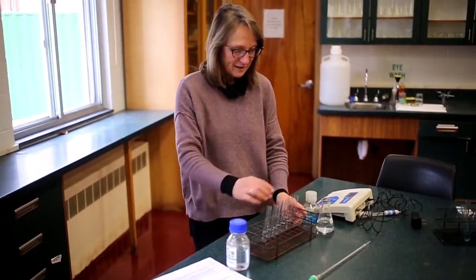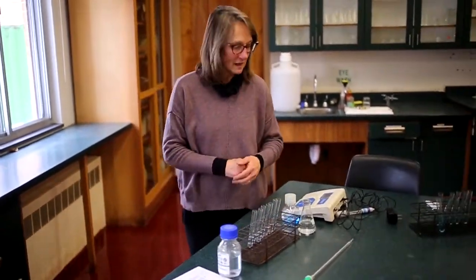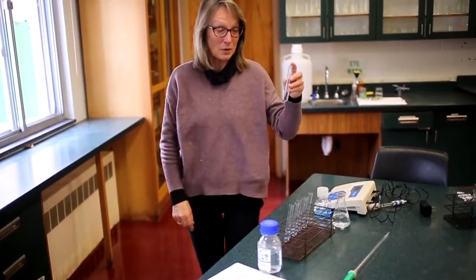All right. Okay, so now Janet and Melanie have given me another challenge. They have given me a solution that has such a low amount of copper sulfate in it that I can't use my standard curve. So I'm going to try to be clever and figure out a way that I can measure really, really dilute concentrations of copper sulfate. So I'm going to do a little demo here.